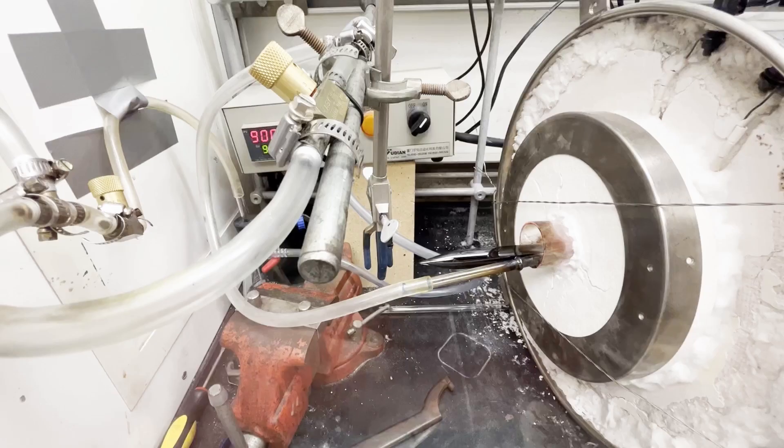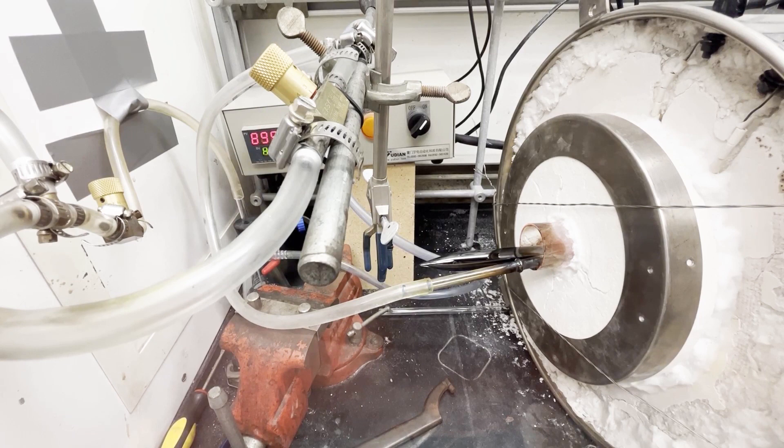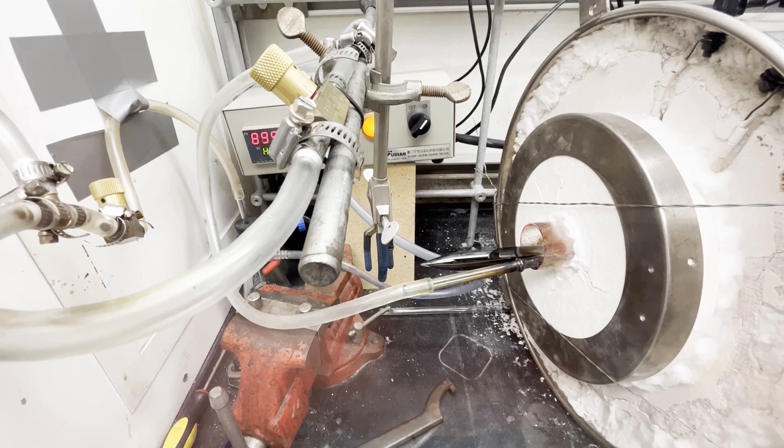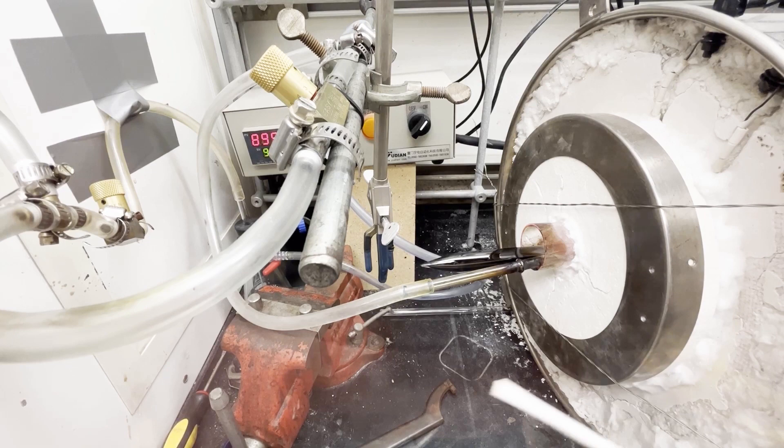If you need a more thorough method of carbon coating, you can also do it in a furnace. Here we have that set up. We have our furnace held at 900 degrees Celsius. We have acetone over here, I assume to be acetone, flowing into our T-joint here.